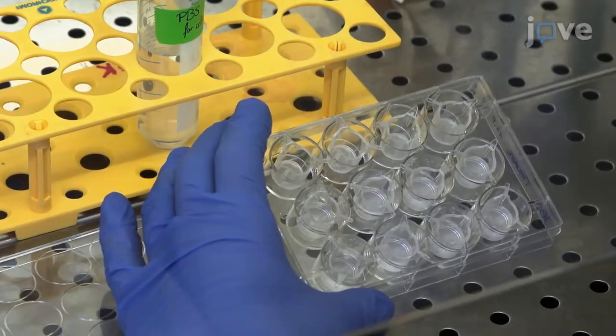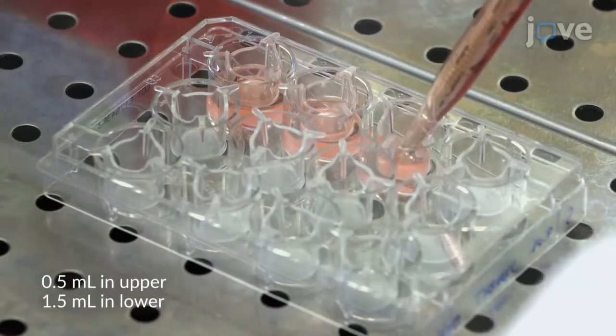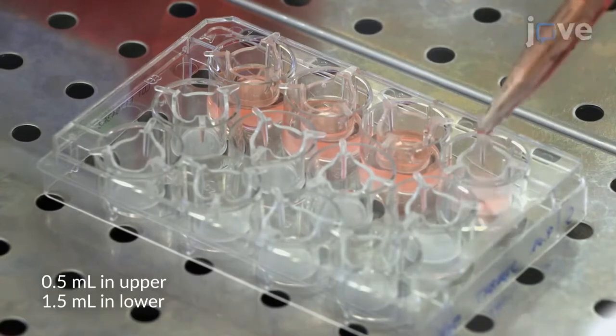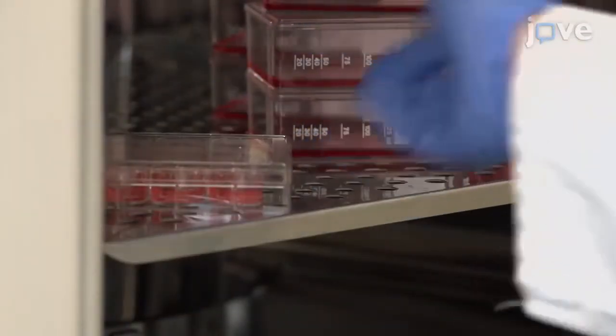Then equilibrate the membranes by pipetting pre-warmed DMEM F12 medium into the upper and lower chambers and incubate the plate at 37 degrees Celsius with 5% carbon dioxide.